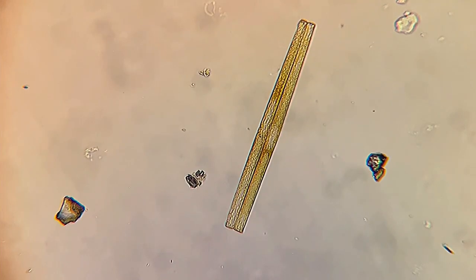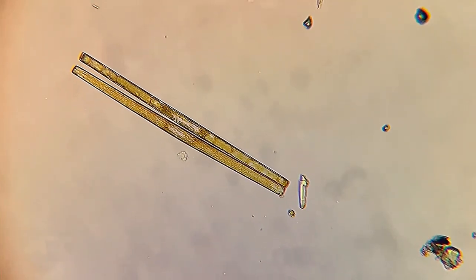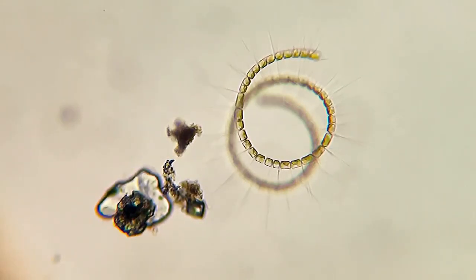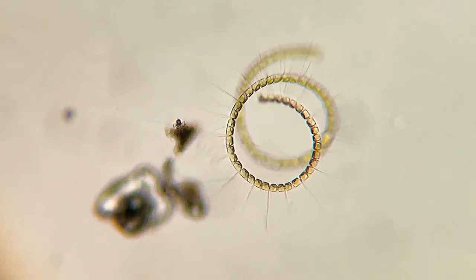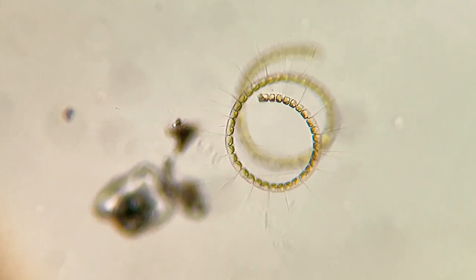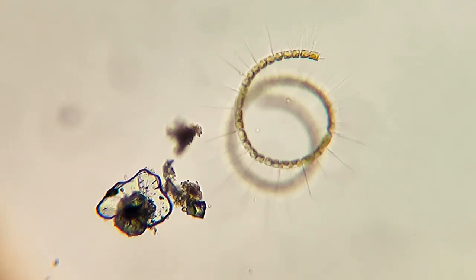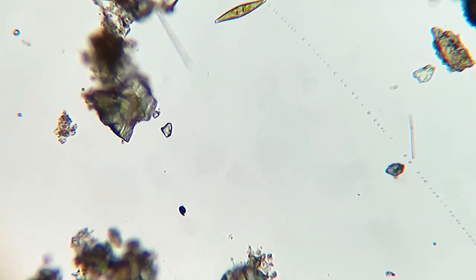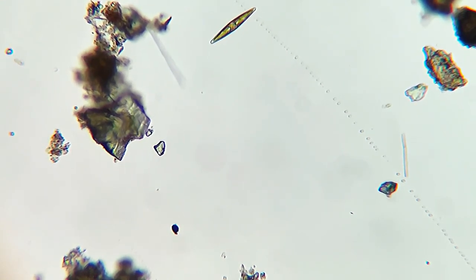These are other diatoms that actually look like chopsticks. And another beautiful colonial diatom. Some diatoms like this one are actually able to move, and they look like navy ships when they move.